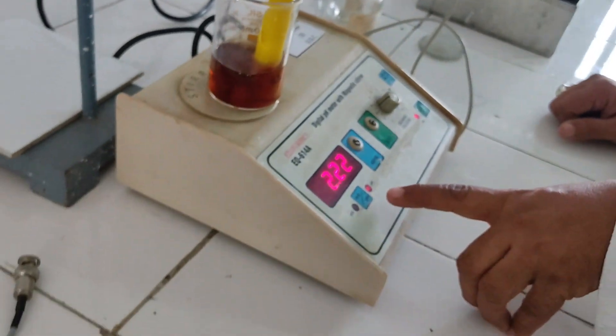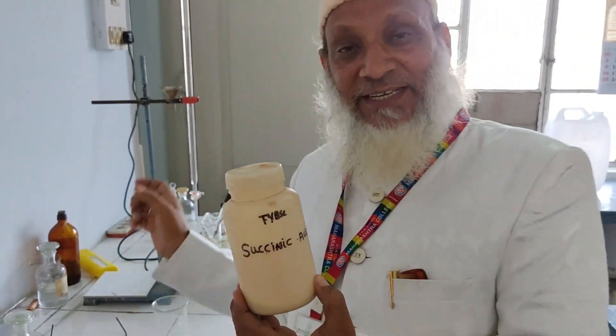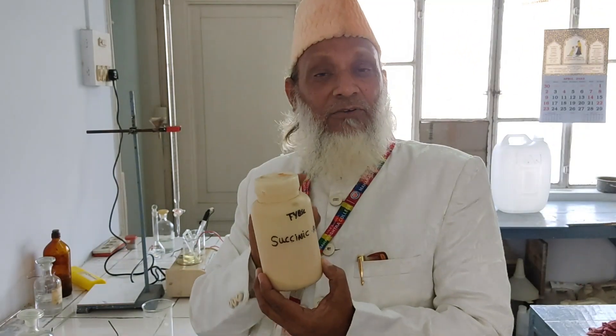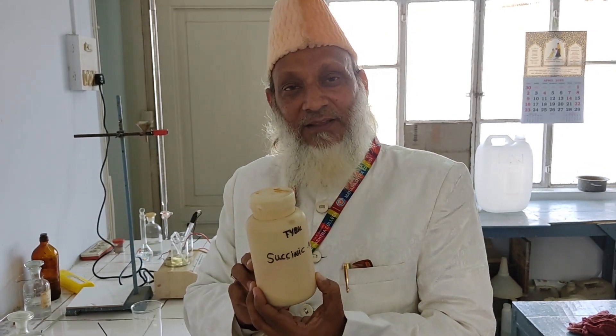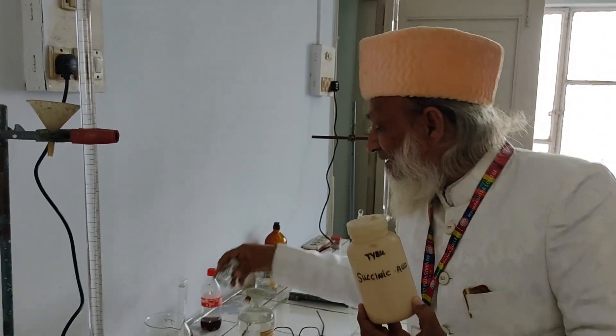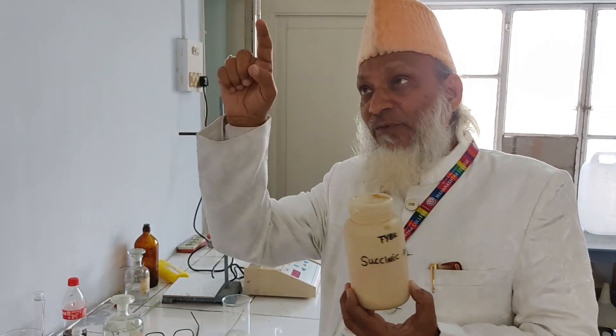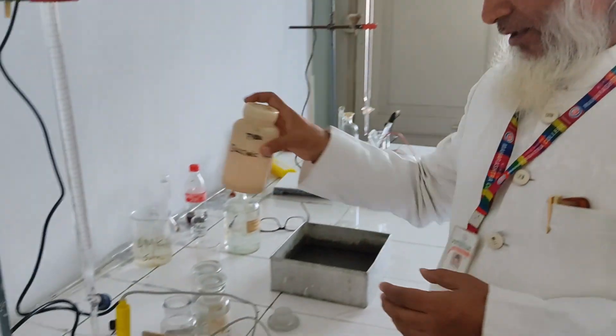This is the pH of the solution at zero volume addition of NaOH. Remember, this NaOH is 0.1 normal approximately. We have standardized this NaOH with succinic acid by weighing 0.59 grams of succinic acid, dissolving and diluting to 100 centimeter cube with distilled water, taking out 10 centimeter cube of succinic acid in a conical flask, and titrating with NaOH in the burette with phenolphthalein as an indicator. By knowing the volume of NaOH, we find the exact normality of NaOH using N1V1 = N2V2.